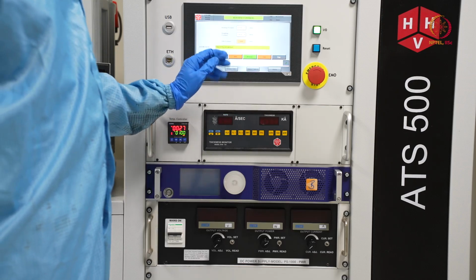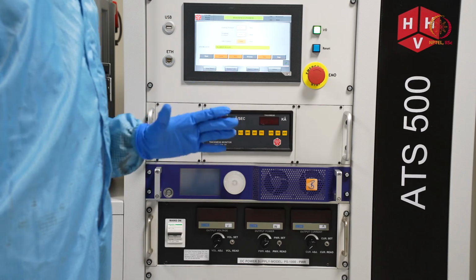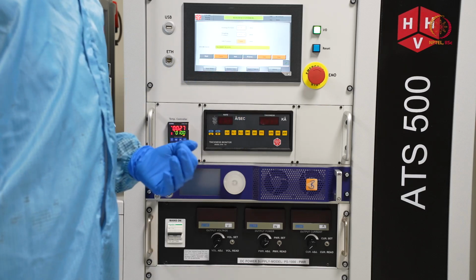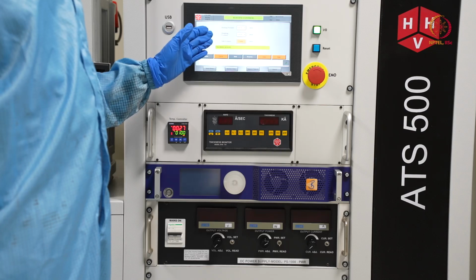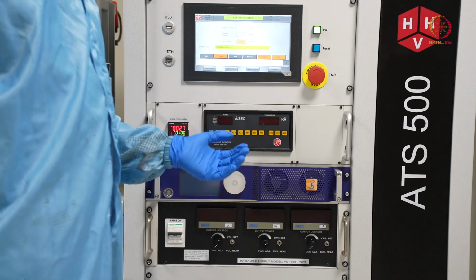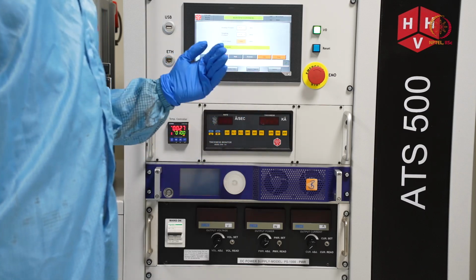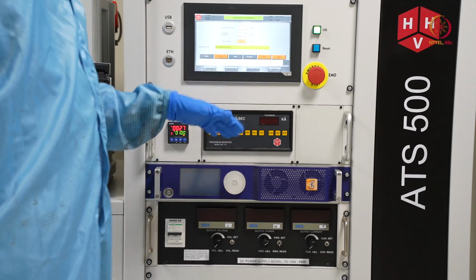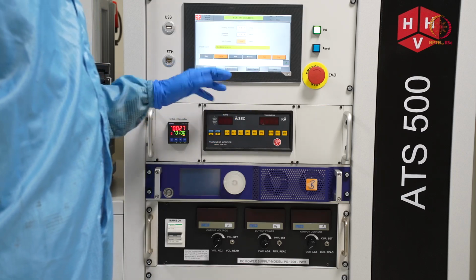We have to close this first, so we will press seal. This step is almost similar to what you have seen in case of electron beam evaporation. Both are from similar make, so options are also similar. When your chamber is sealed, we have to go for venting to open the chamber. As we have deposited just now, after deposition is over, we should wait for at least 10 to 15 minutes to cool down the things. Till that much time we will wait.